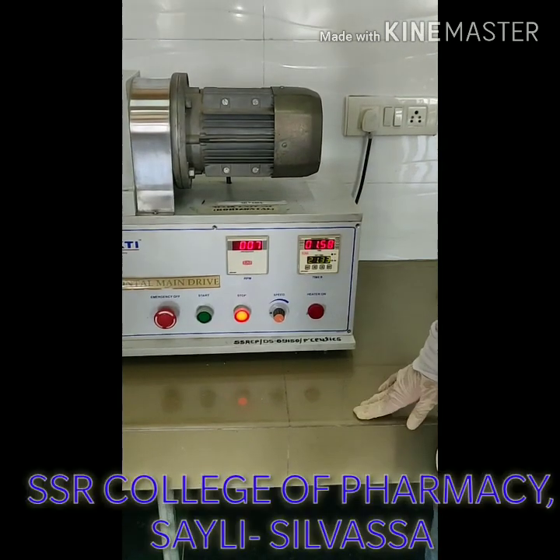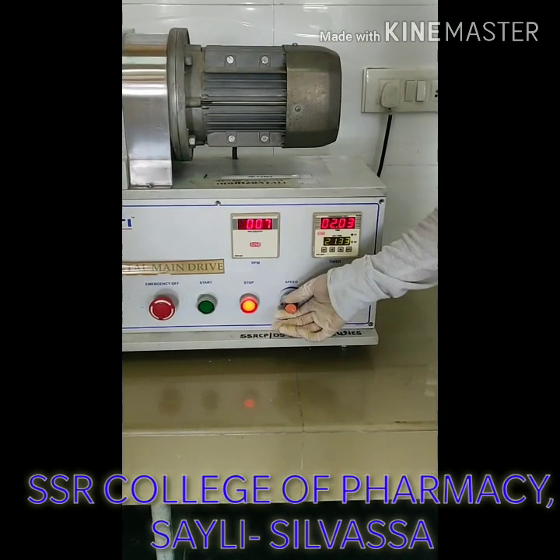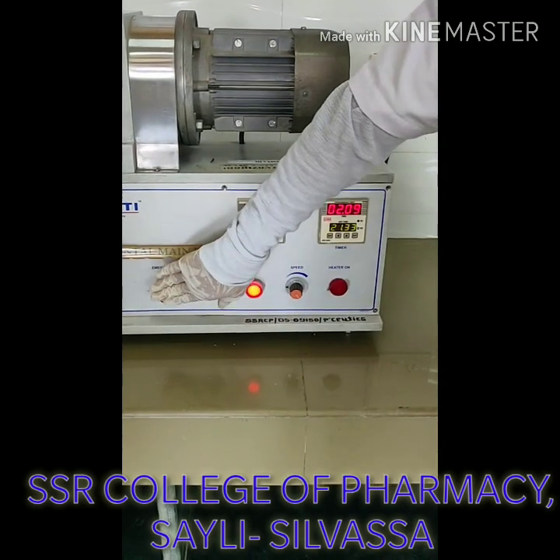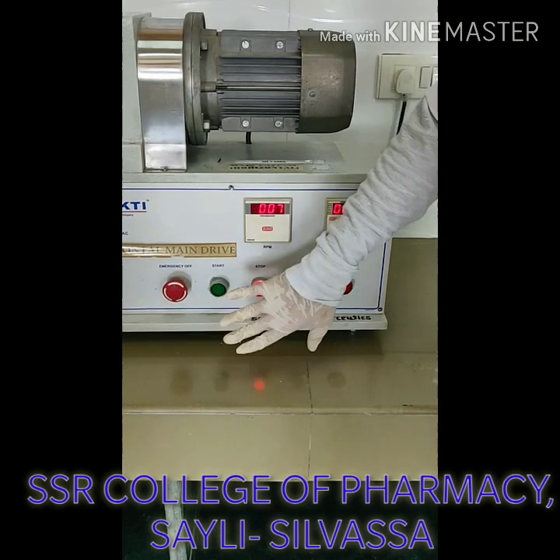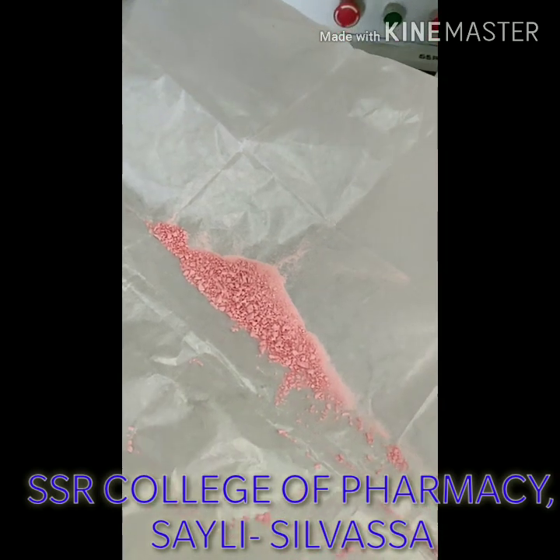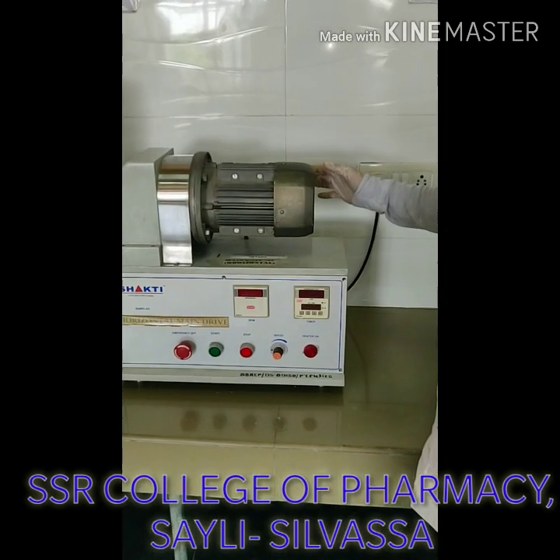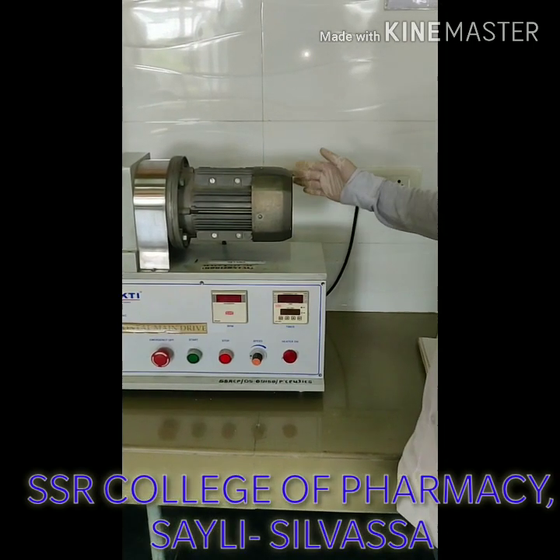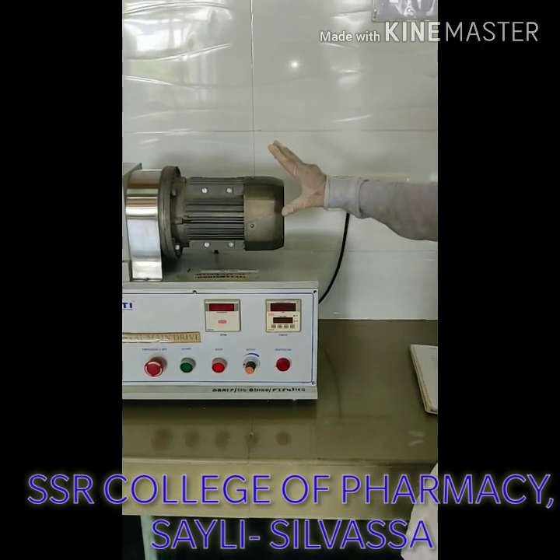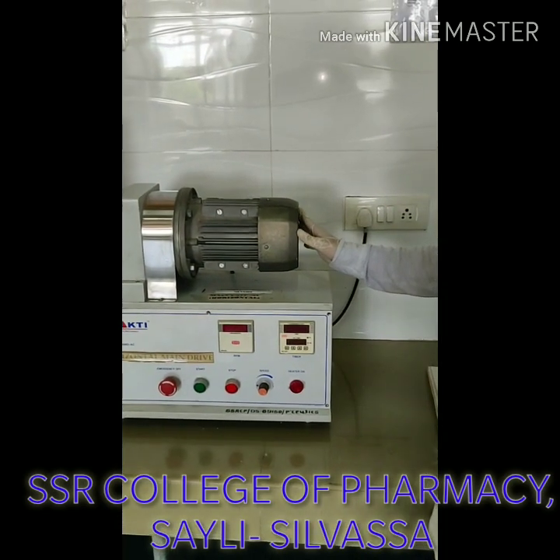After the completion of operation, you have to switch off this instrument by switching off all the controls. You have to adjust the speed knob to zero, press the emergency button to stop it, and switch off the main regulator button. These are the granules you can see which I made from the dry granulator. So thank you friends — from this video you can learn how to operate, how to adjust the speed, and get perfect knowledge about the dry granulator and horizontal main drive. Thank you so much.